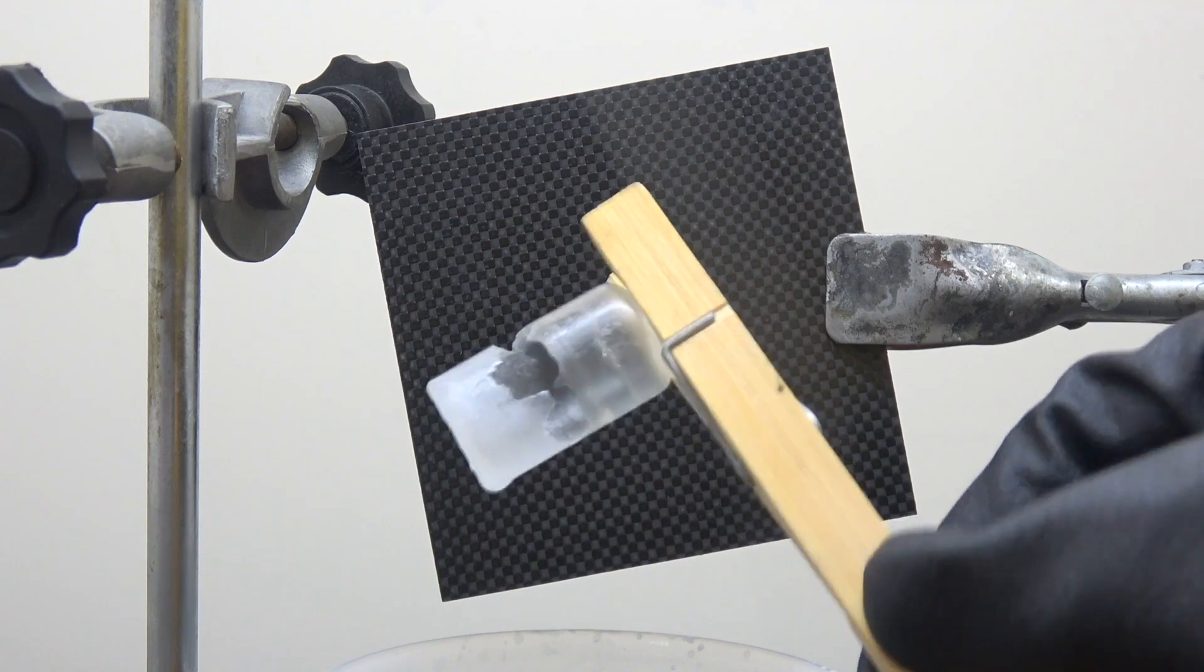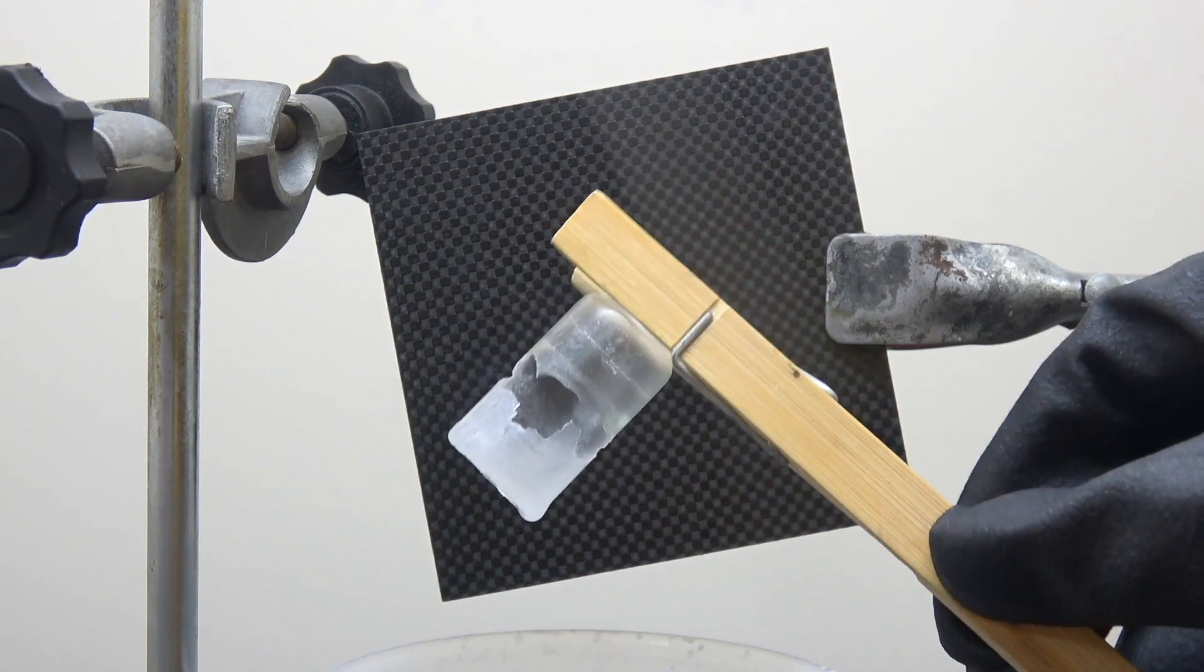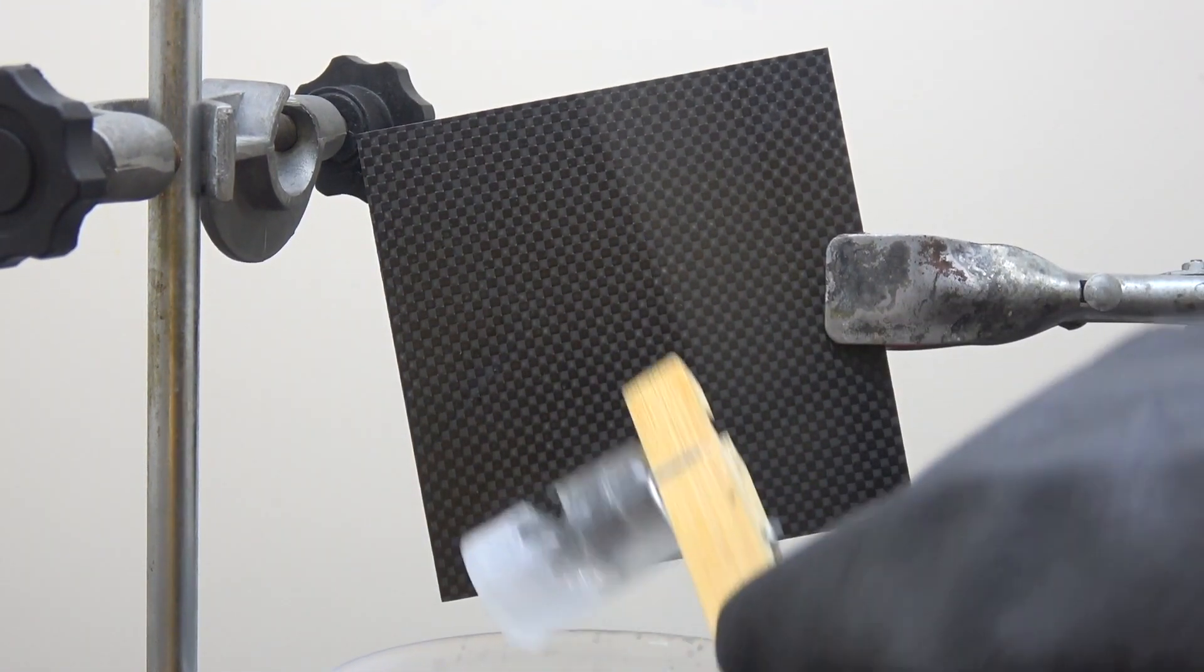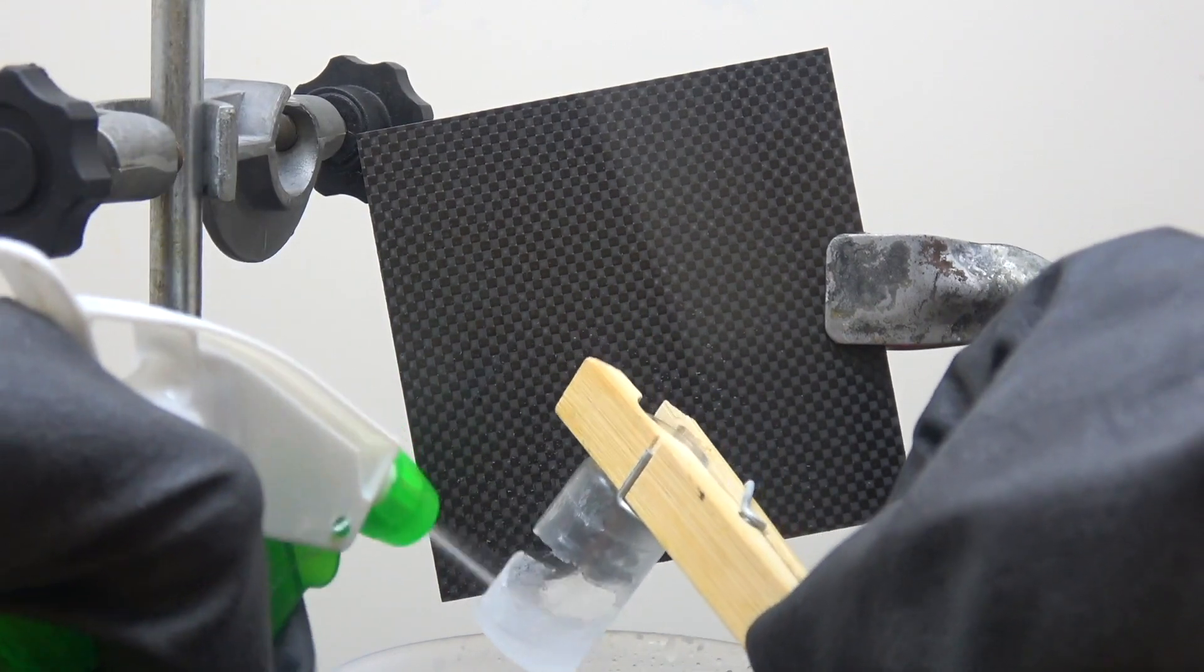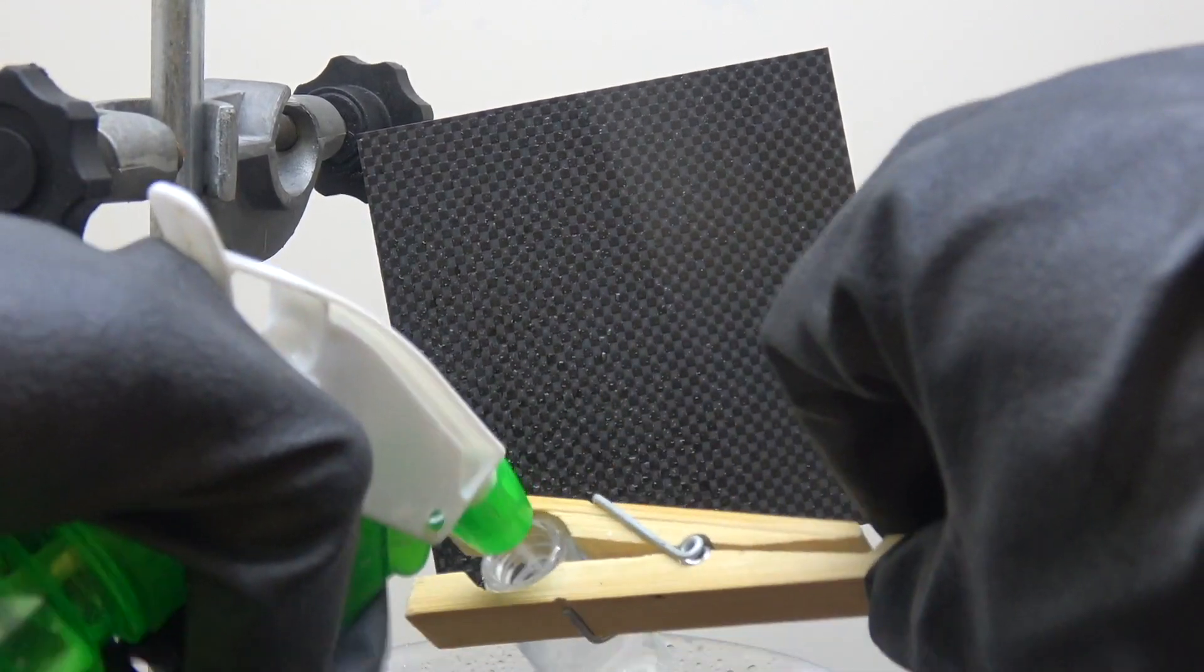The hydrofluoric acid ate a hole through the back, as well as a hole on the bottom. Let me just clean it up a little so we can see it better.